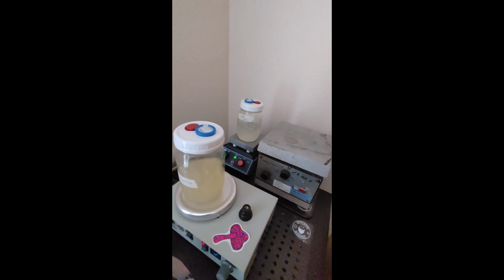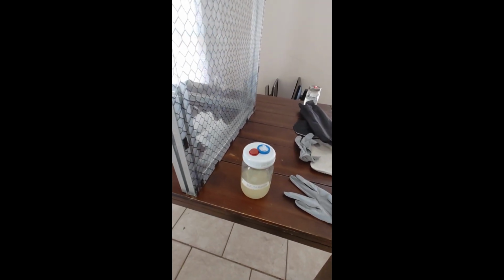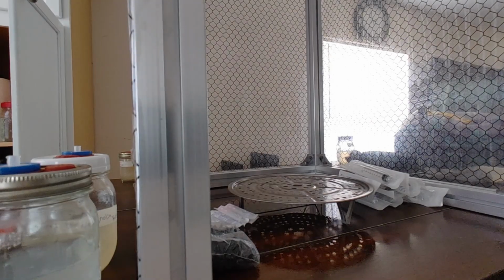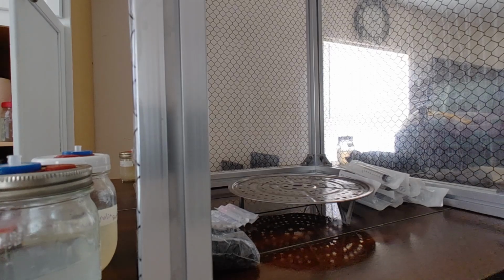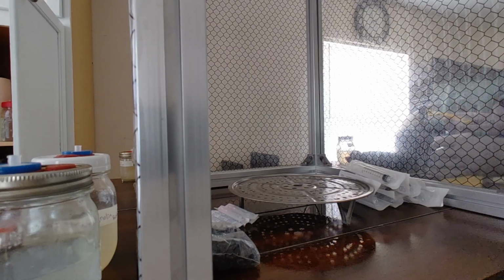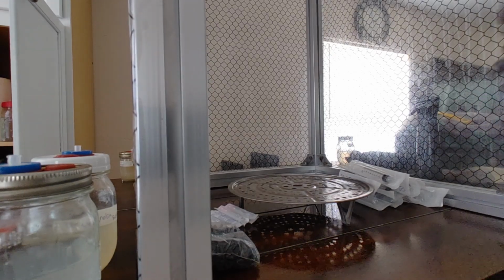So I'm gonna go ahead and grab one. Set it outside. We're gonna spray this down with some ISO before we put it inside in there. Getting it all ISO'd up over here. Gotta get my glove back on real quick. And as you can see, or maybe not see, I spray the top down, spray it all down, all over. And then I spray my hands down, rub it down real good. Get that ISO all over.